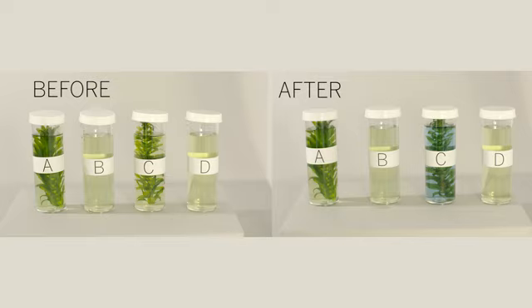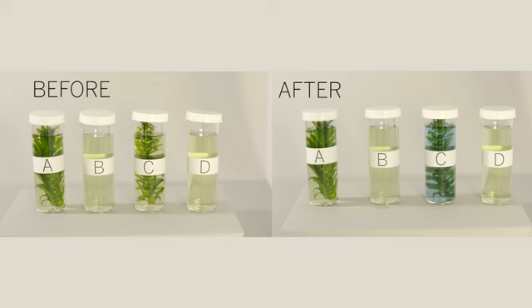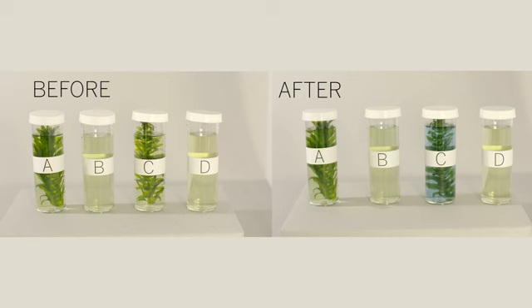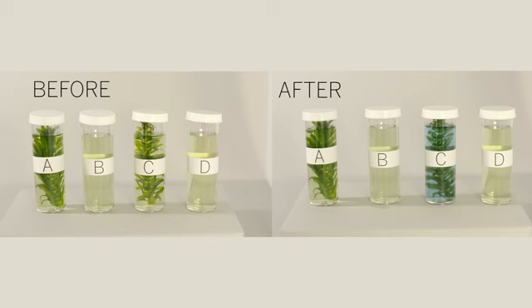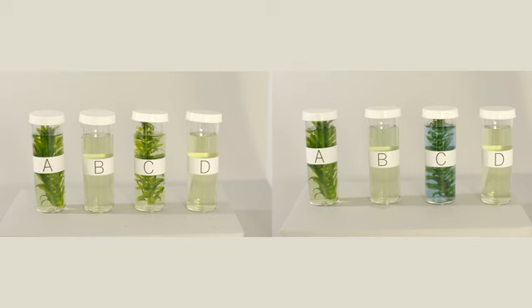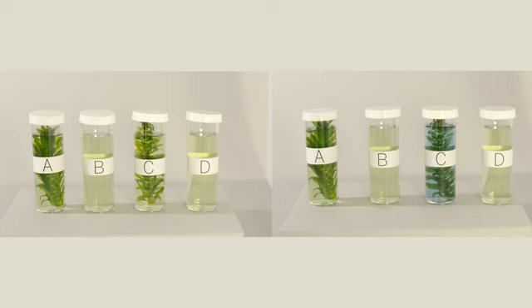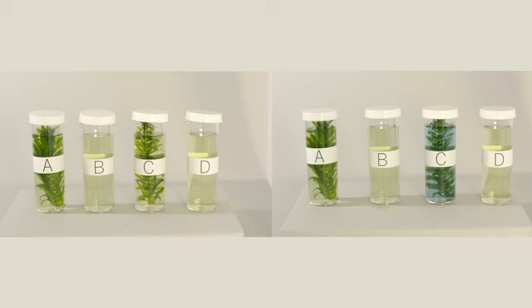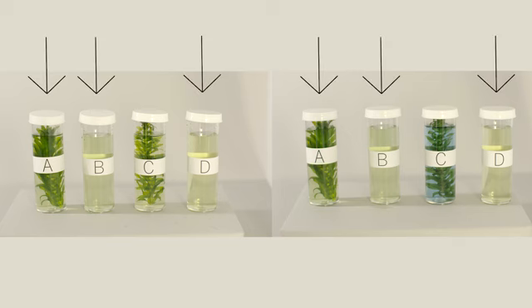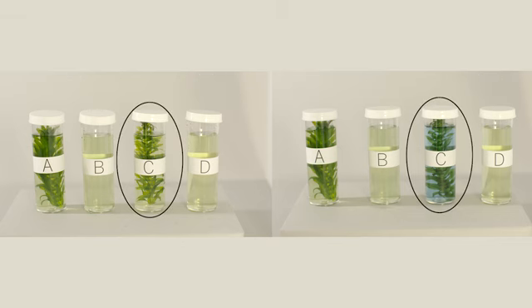Now that 12 hours have gone by, we're going to take a look at what happened. Did the plants perform photosynthesis? To find out, we need to look at the level of carbon dioxide in the water. We can see that the levels of carbon dioxide stayed the same in vials A, B, and D. However, vial C changed color from yellow to blue.